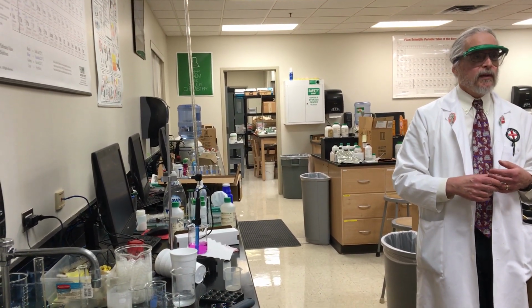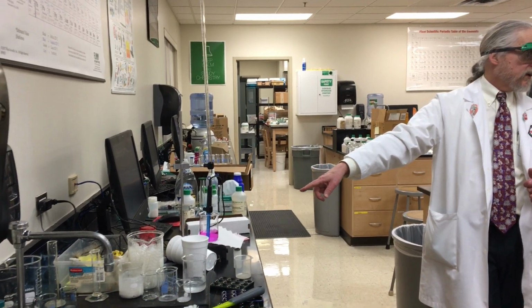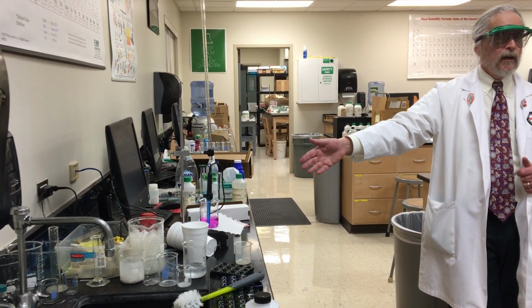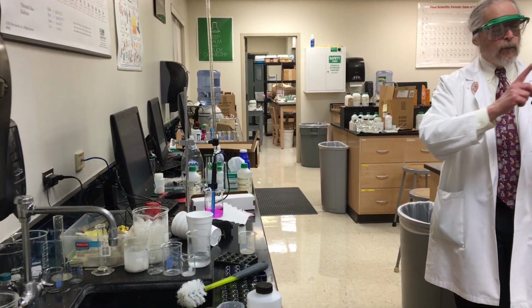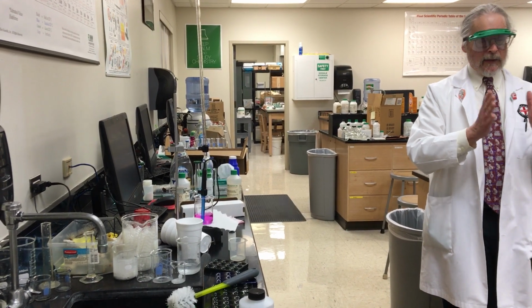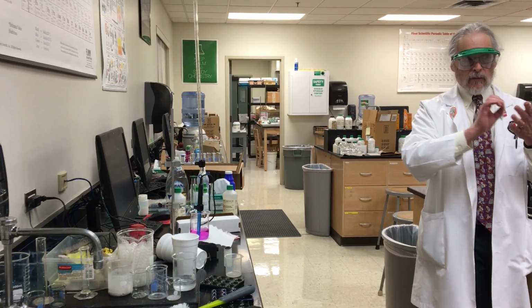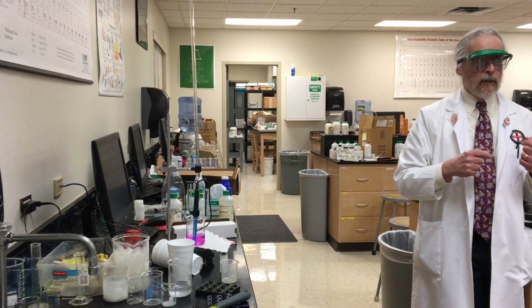You want to pick something where you're starting with either the lighter color or the colorless one, and it's going to go to the darker color or a color like pink in this case. You want to be able to see. We call the point where you add that last drop and you go, okay, that's it. That's where my moles of acid equal moles of base. It just turned pink, light pink, stayed there. I'm done. Write it down. That is called the end point.